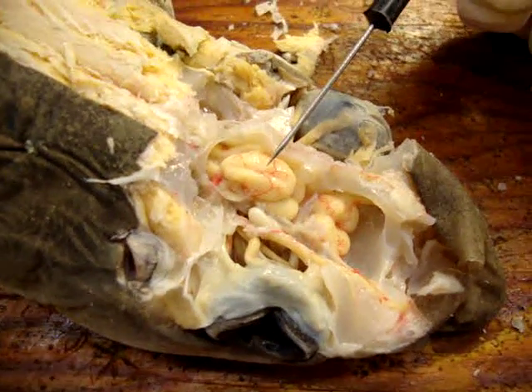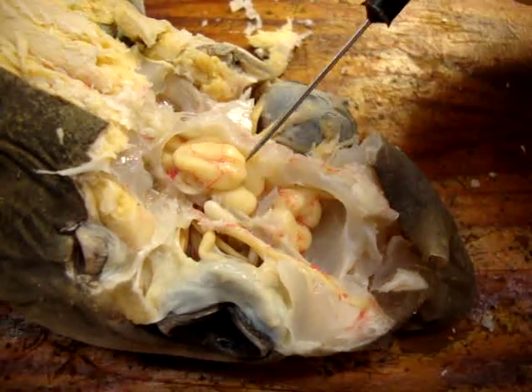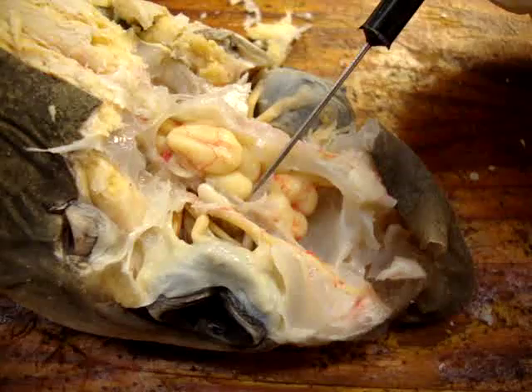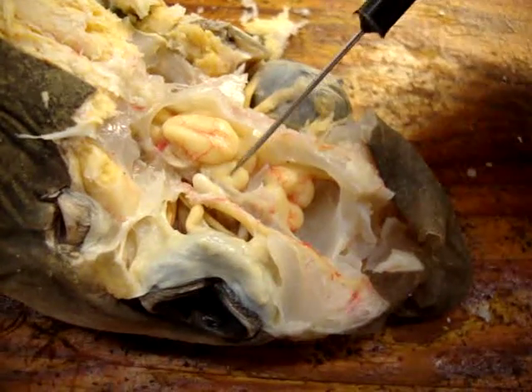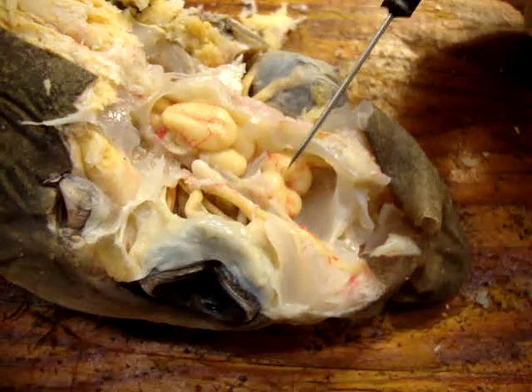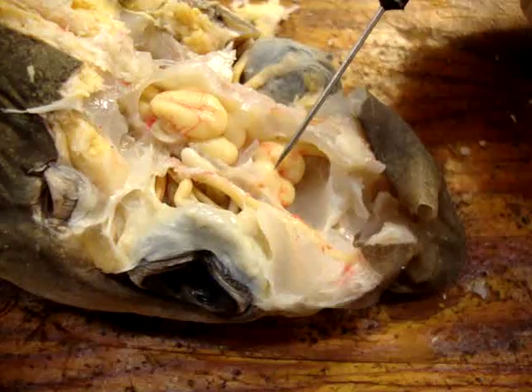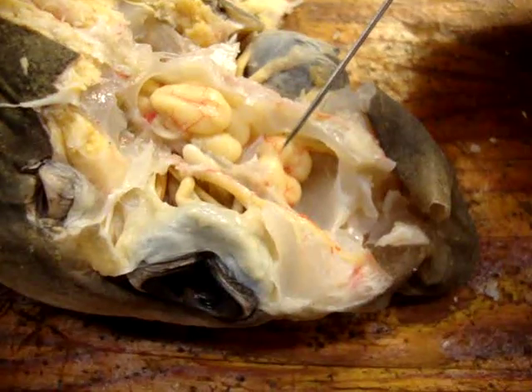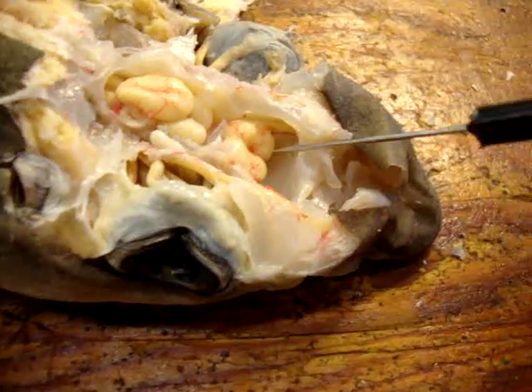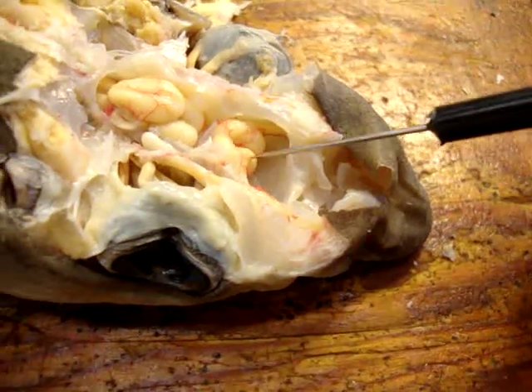This is the cerebellum. The lobes underneath are the optic lobes, these two. These bumps right here are the cerebral hemisphere. The bumps underneath are the olfactory lobes.